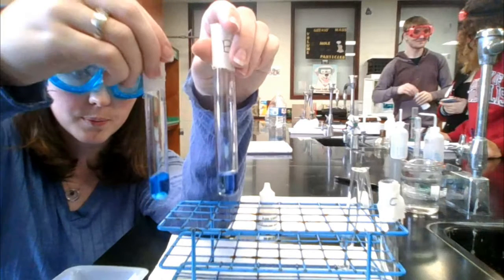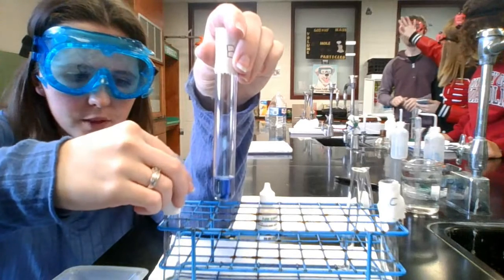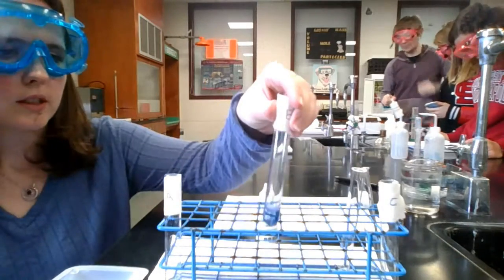solution. What is happening here is as the calcium chloride dissolves, it sends calcium and chloride ions into the solution. The calcium doesn't do anything because calcium doesn't have any part in the reaction. But the chloride ions are used up as a reactant in the production of the cobalt tetrachloride ion. So that chloride is used up and it shifts the reaction that way, producing that bluer color due to more cobalt tetrachloride. So we're going to let that reaction go.